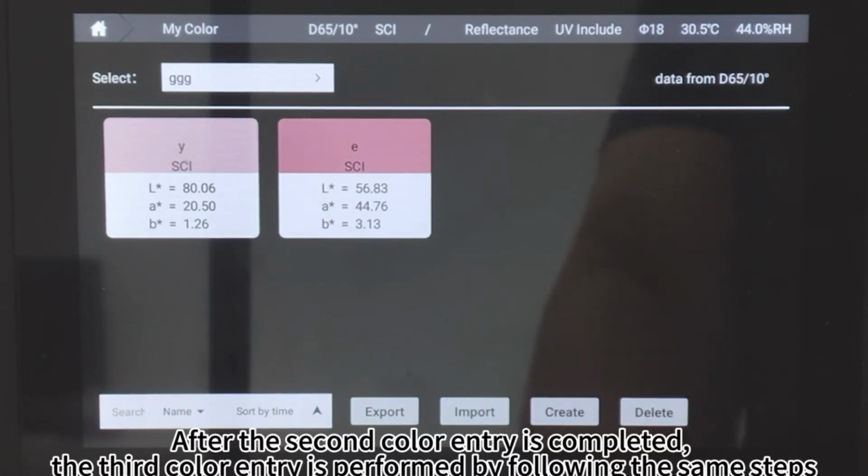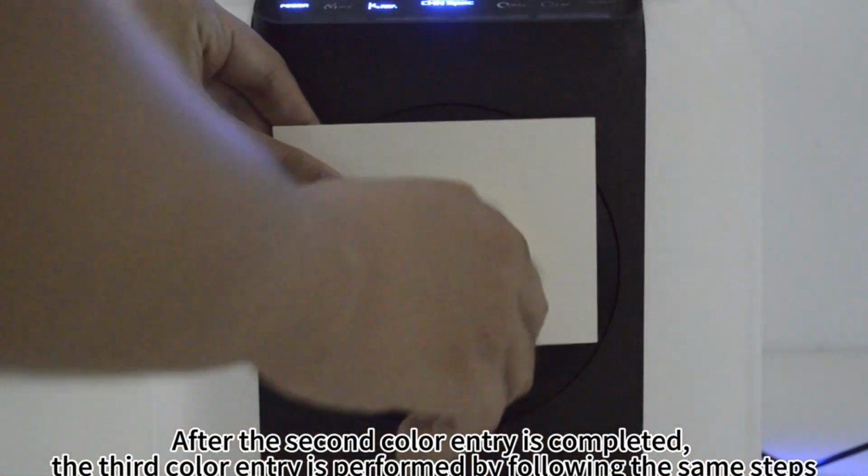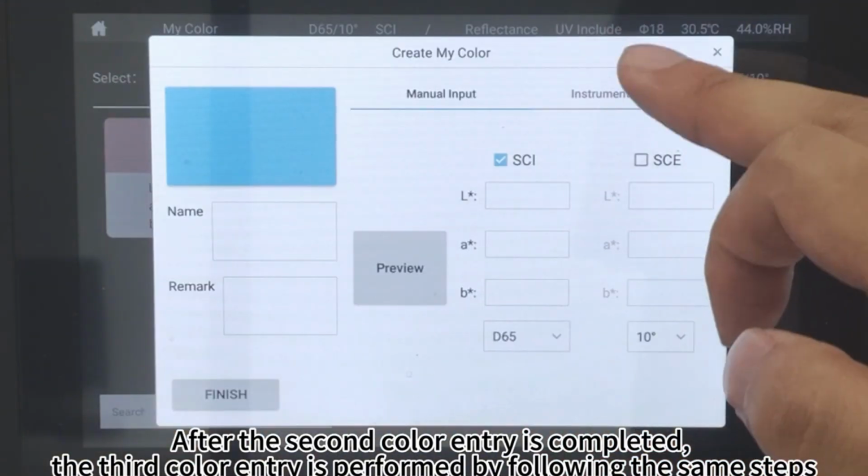After the second color entry is completed, the third color entry is performed by following the same steps.